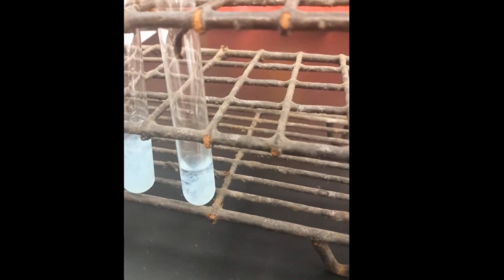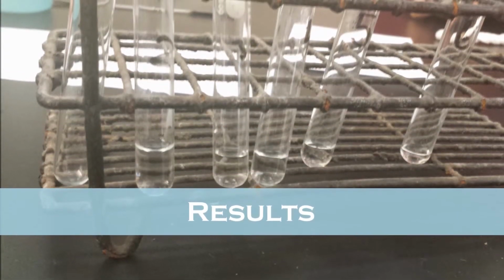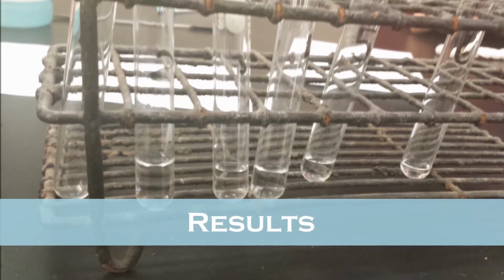The pipette was then filled with the second solution, sodium phosphate, and based on the specifications on the same data table, a certain amount of drops were put into the same test tubes. A stirring rod was then used to mix the solutions in each test tube. After 10 minutes, we recorded the results on our data sheet. After completing the lab, we came across various precipitation heights in each of the 7 test tubes.